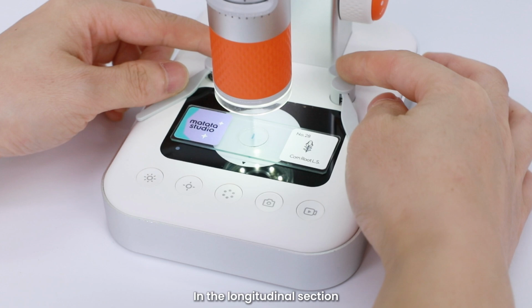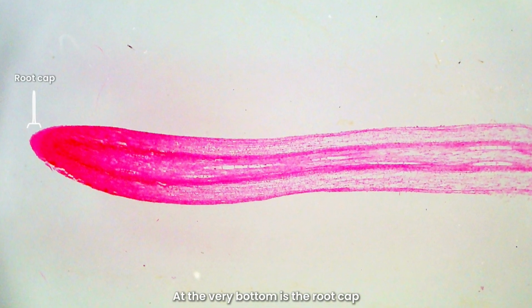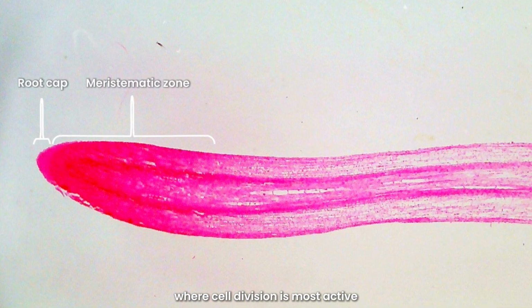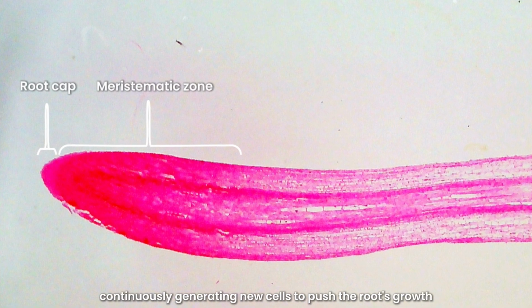In the longitudinal section, we can see different parts of the root. At the very bottom is the root cap, which protects the root tip and helps the root penetrate the soil. Next is the meristematic zone, where cell division is most active, continuously generating new cells to push the root's growth.